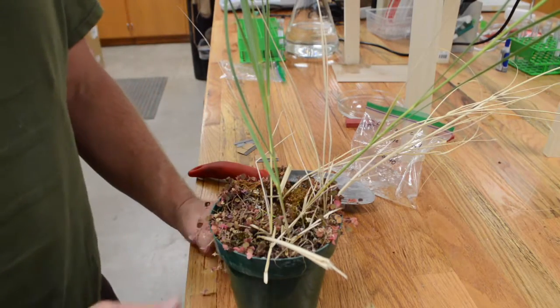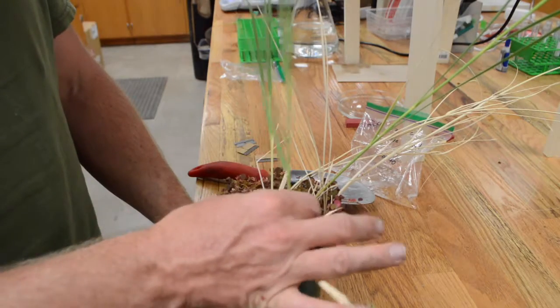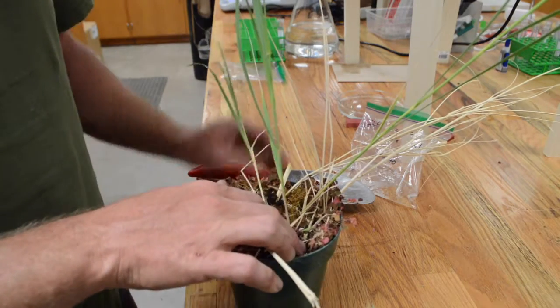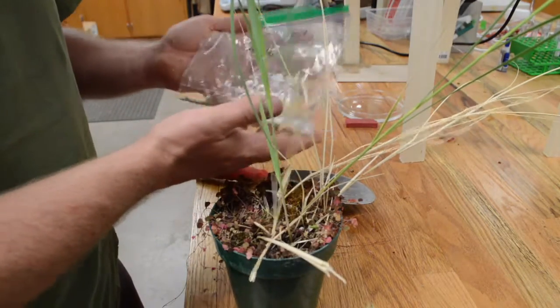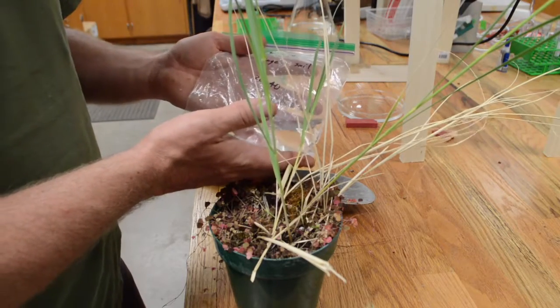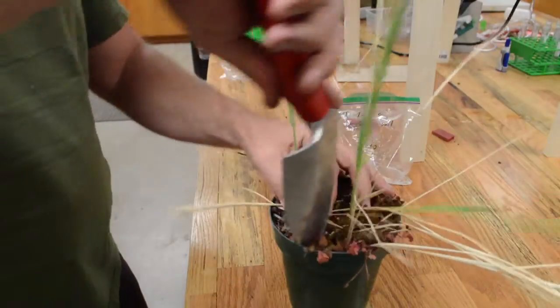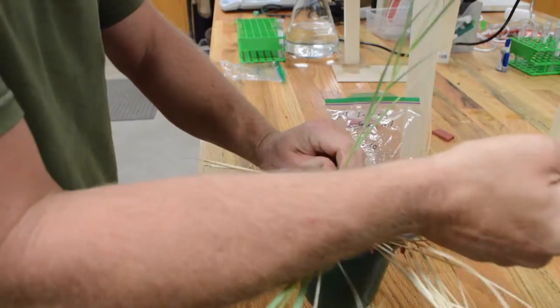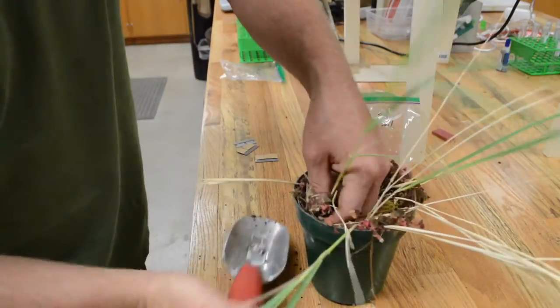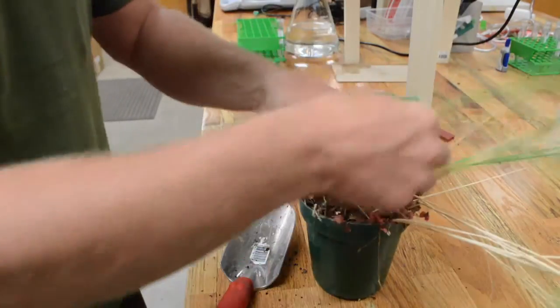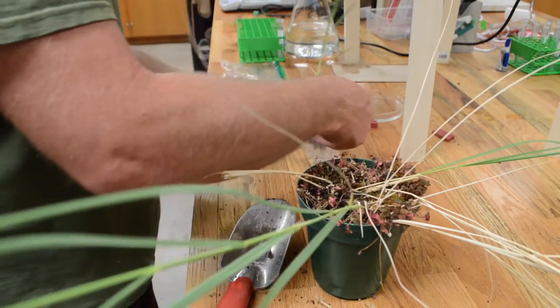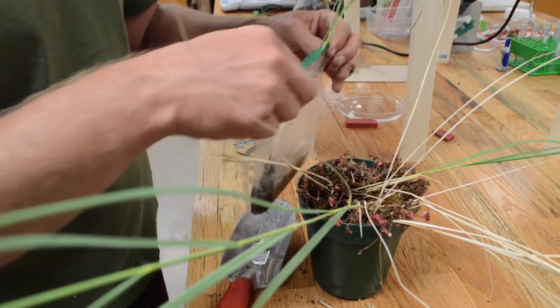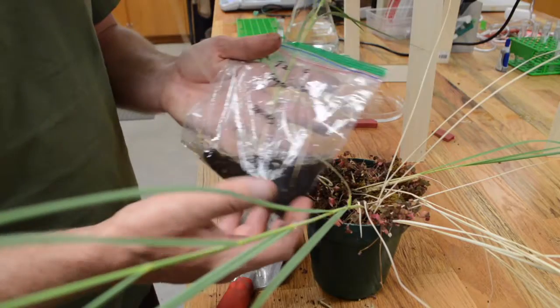When I'm in the field and sampling a grass or a forb, what I like to do is not only remove the stem here, but I want to remove part of the root system as well. And then as soon as I remove it, I'm going to put it in a plastic baggie or some reservoir with a little bit of water to start that rehydration process right away. So I would just dig down in here a little bit. This doesn't work very well because it's potting soil and not actual field soil. But I would try to get down there and remove the stem with a little bit of the root system. And then I'll put it into the water. Then I would take this back to the lab and I'll show you the next step.